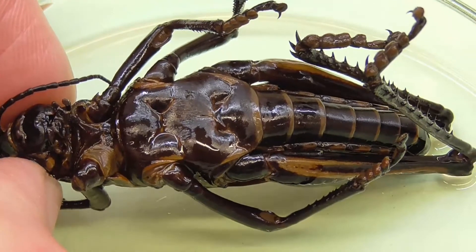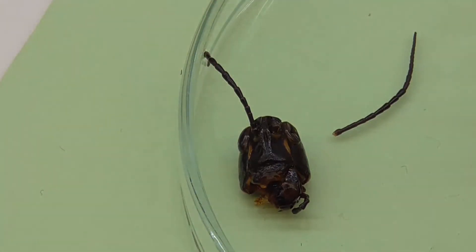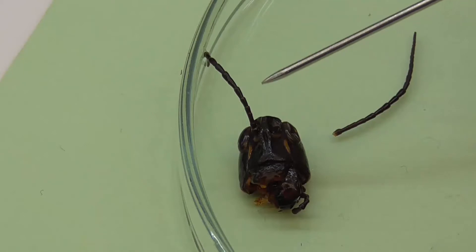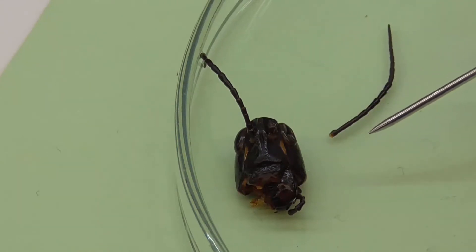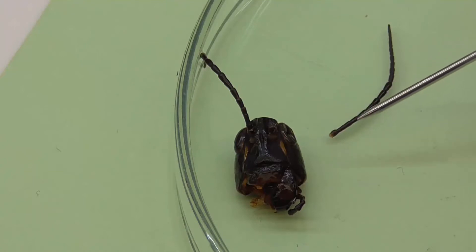Now we'll look at the head parts. I've prepared one earlier by taking the head off the insect. The head is made up of lots of specific parts. Firstly, you've got the antennae coming off the head. This is one I've taken off — it has a scape, a pedicel, and a flagellum. Those are the major parts.